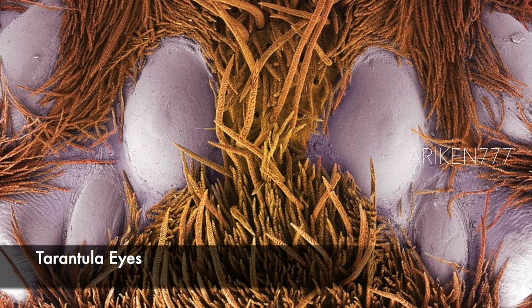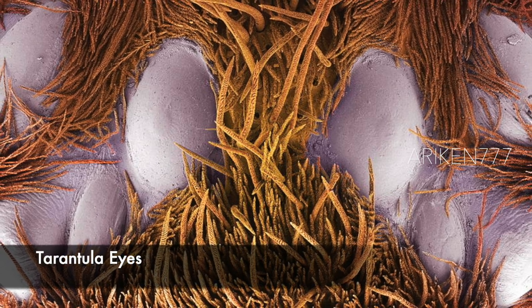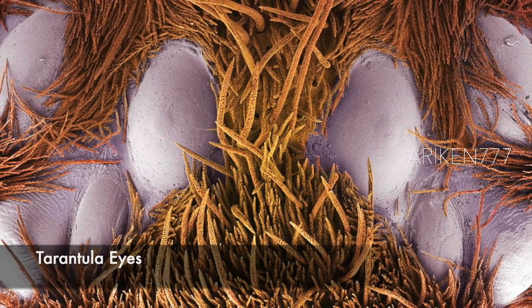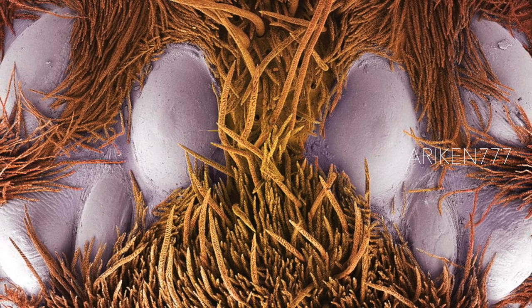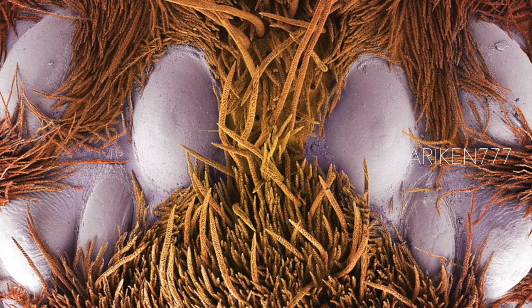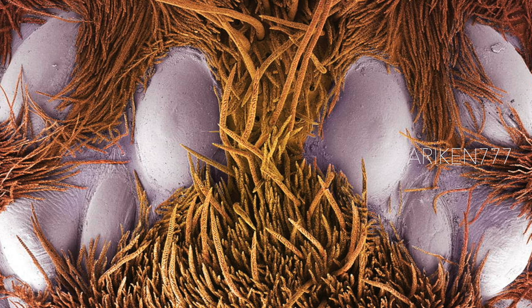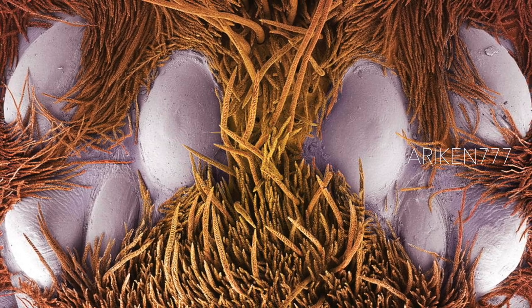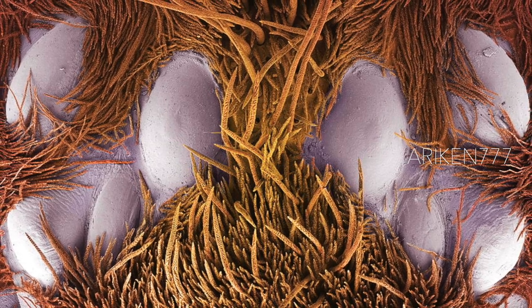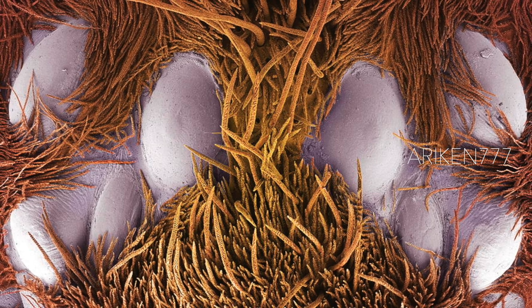The eight eyes on the head of a Mexican red-kneed tarantula. This tarantula does not have very good vision, mostly relying on its sensitivity to noise and vibrations detected with its leg hairs. The eyes are located on a raised bump on the head.